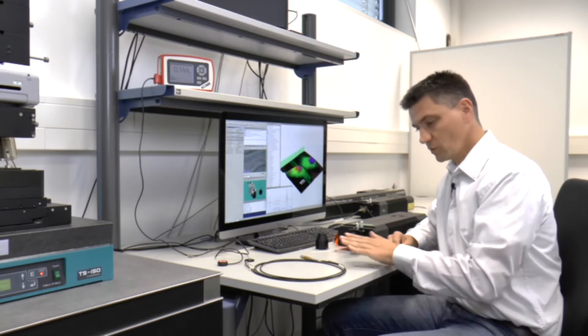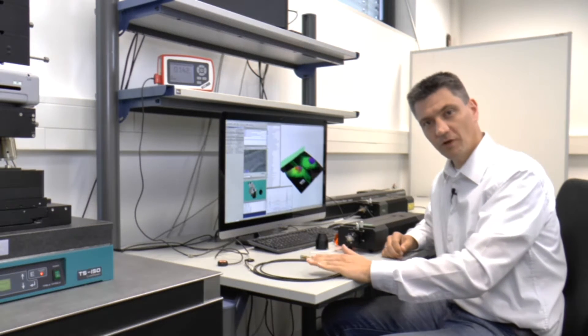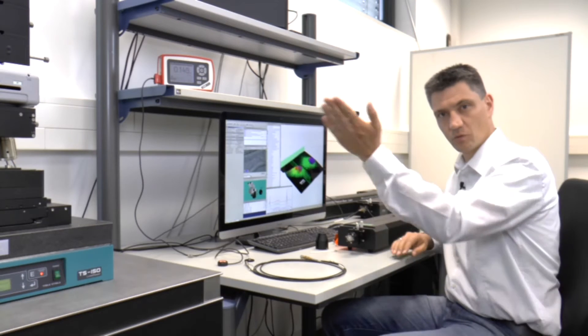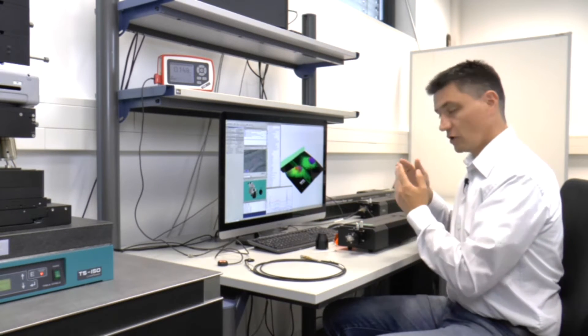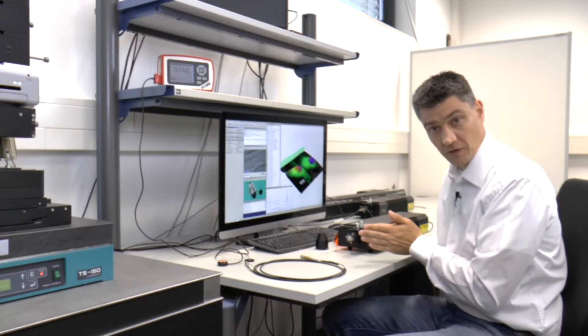We start with the single mode optical fibers. The single mode optical fibers are used to couple the lasers with the microscopes. In order to show you the effectiveness of this coupling we will first measure the power out of the laser and the power through the fiber.